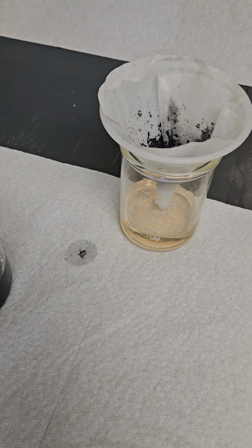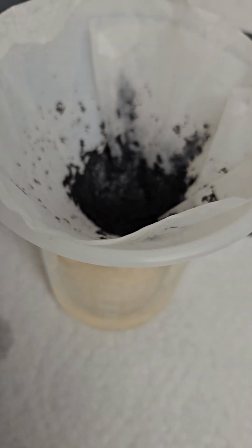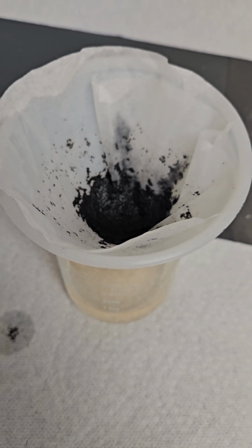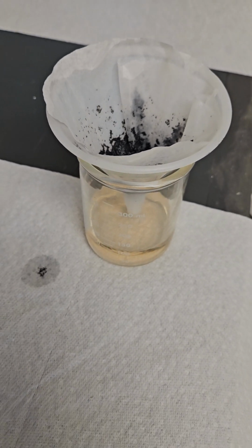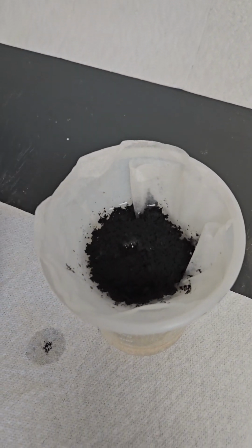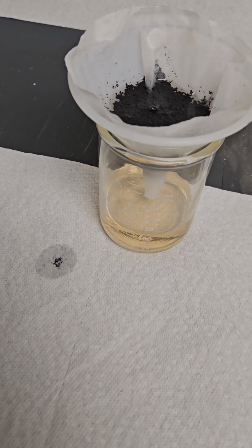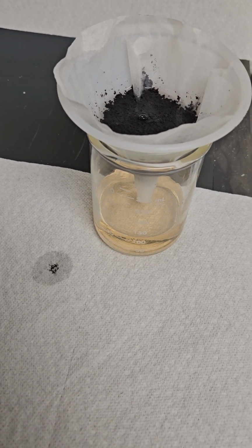But it's a much more acidic coagulant than the current coagulant they're using, which is like aluminum chlorohydrate. It's like our polyol 600, which isn't really effective when the pH is that high. As you can see, this is one alternative. The other alternative would be if you said you wanted to use sulfuric acid. I'll have to do a different test on that to see the clarity in the dosage and everything.